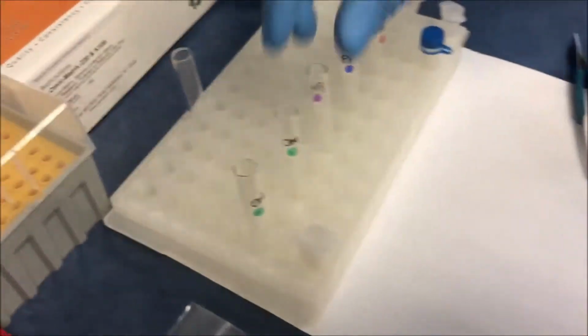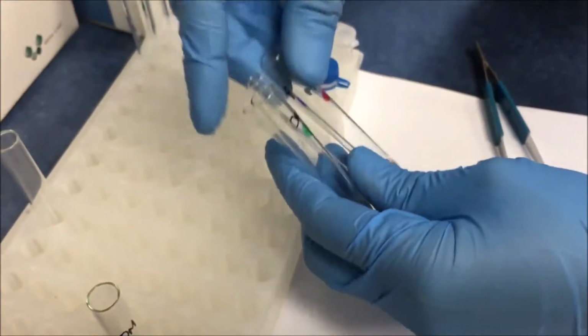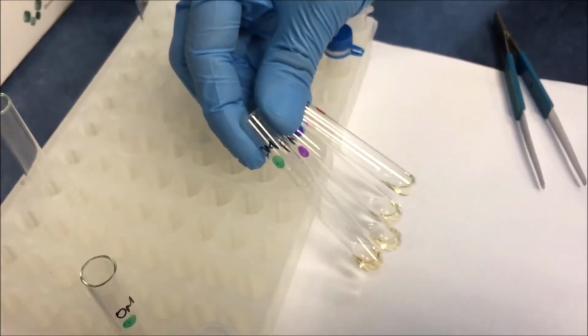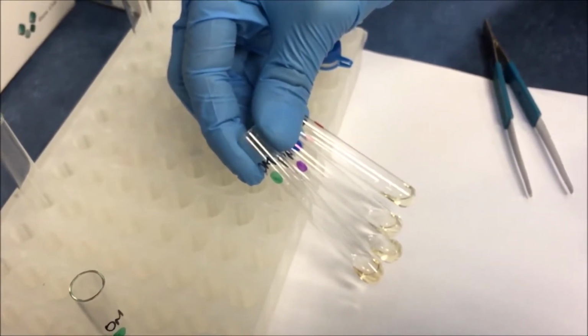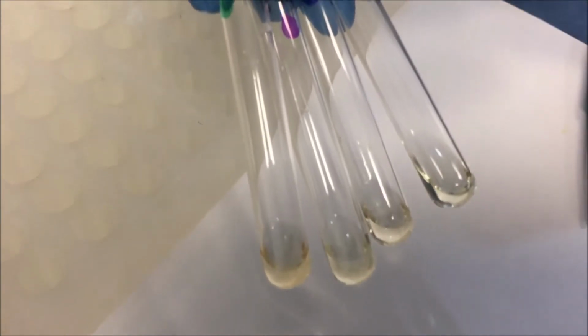Now we are going to show you the Omni-Matrix, which was in each of these different lysis buffers. The color code is green, which was the Omni-Mag lysis buffer. The purple is the PrepFiler from ABI Thermo Fisher, and then the MTL. In all of them, I'm going to focus here, there's no matrix left, and all the matrix is totally dissolved and soluble.